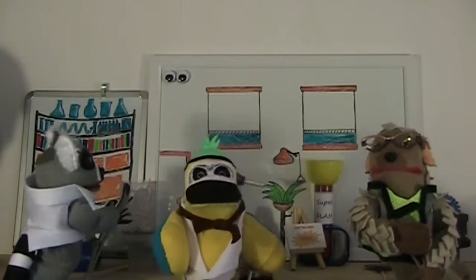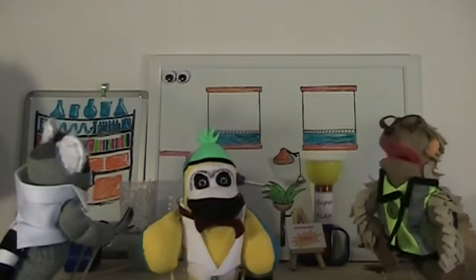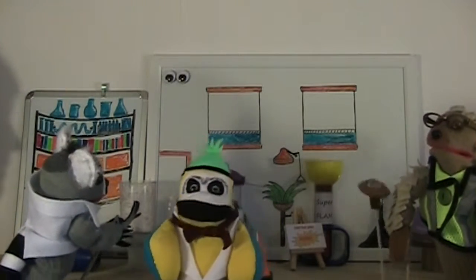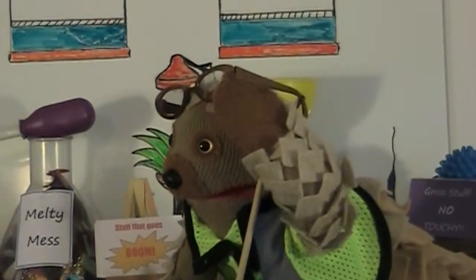Okay, well, this is our laboratory. What's this hole in the wall? This is our hole in the wall. Why do you have a hole in the wall? It's always been here. It's where Stu lives. Hello? Ugh, I never get used to that. It looks like we have a lot of work to do.